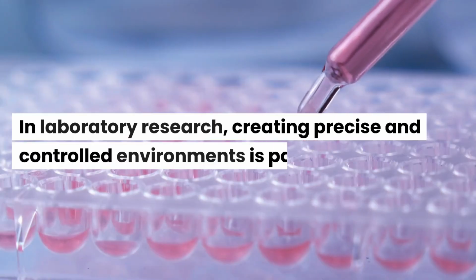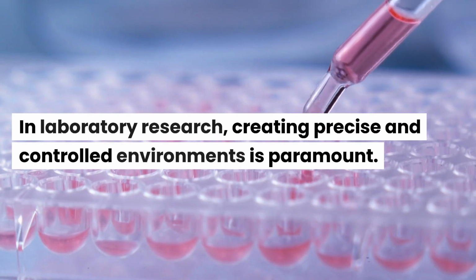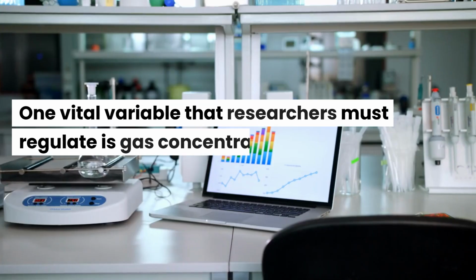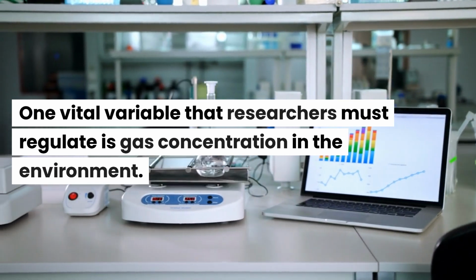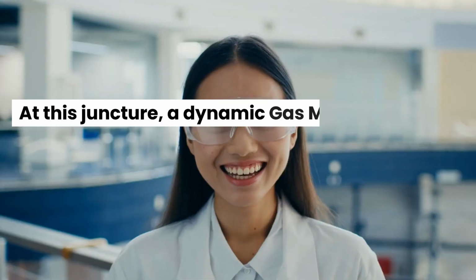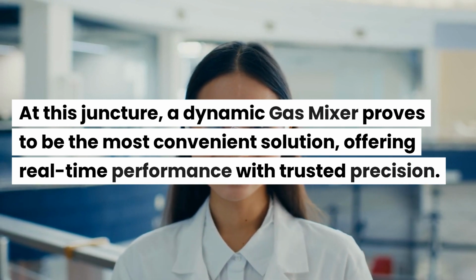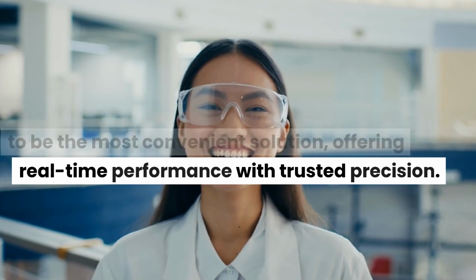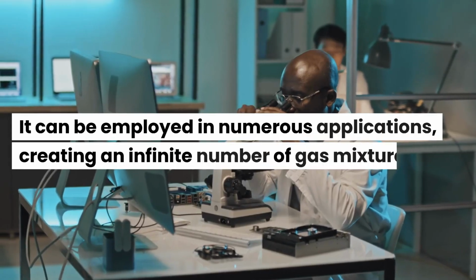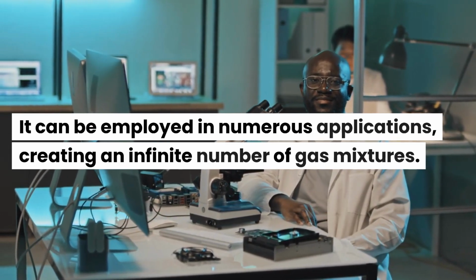In laboratory research, creating precise and controlled environments is paramount. One vital variable that researchers must regulate is gas concentration in the environment. At this juncture, a dynamic gas mixer proves to be the most convenient solution, offering real-time performance with trusted precision. It can be employed in numerous applications, creating an infinite number of gas mixtures.